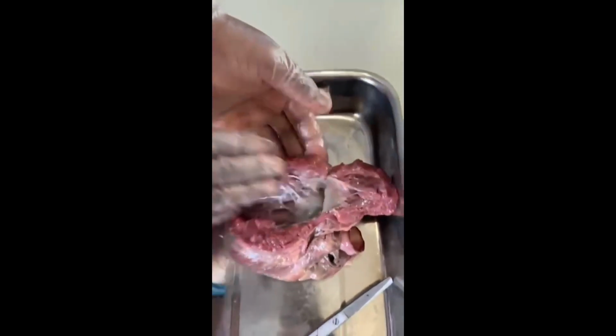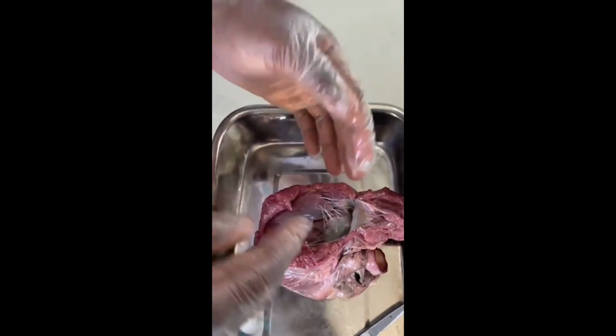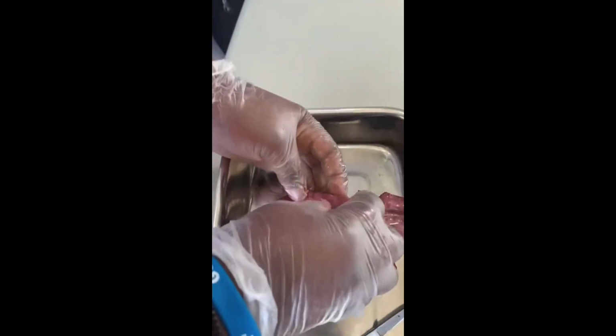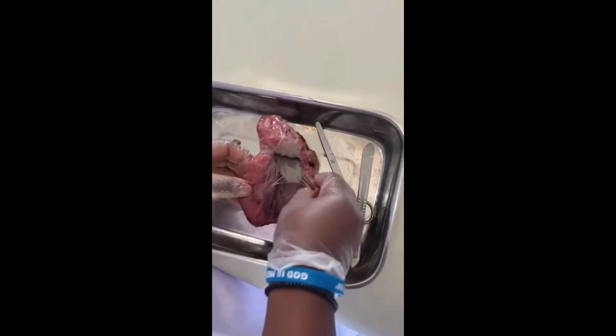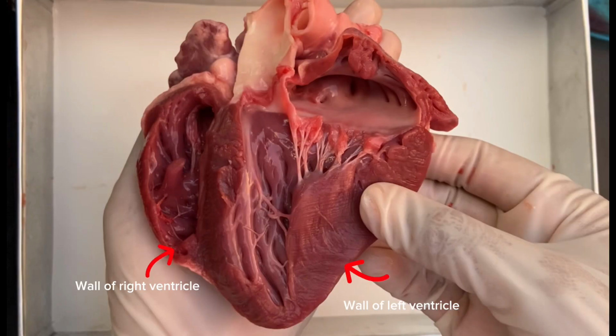The left ventricle and the left atrium are separated by the bicuspid valve, while the right ventricle and the right atrium are separated by the tricuspid valve. As you can observe, the wall of the left ventricle is thicker than the wall of the right ventricle. This is because the left ventricle pumps oxygenated blood around the entire body, while the right ventricle only pumps blood to the lungs, which is a much shorter distance.